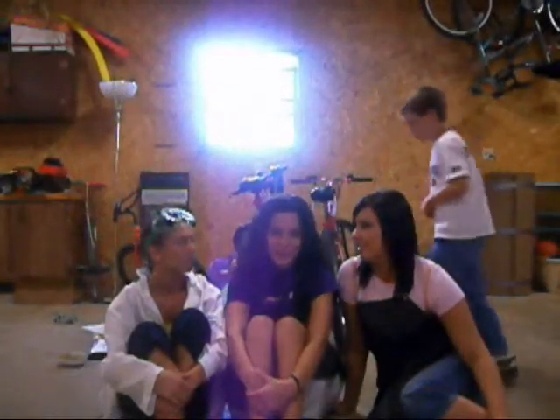And lab number 2, obviously, I was having boy trouble, like always. And I was being very careless and not measuring stuff out correctly. And when I didn't have acetone, I was just like, oh, nail polish remover is close enough. In reality, it's not even close. And I should have been wearing my goggles, and so should have Morgan. But Morgan shouldn't even have been in this part of the video because she should have stayed with her lab partner, who I didn't like. But I really do like you, Chloe and Alyssa.